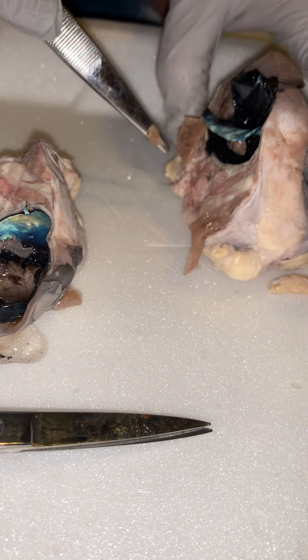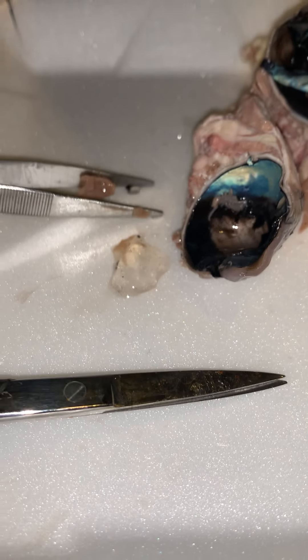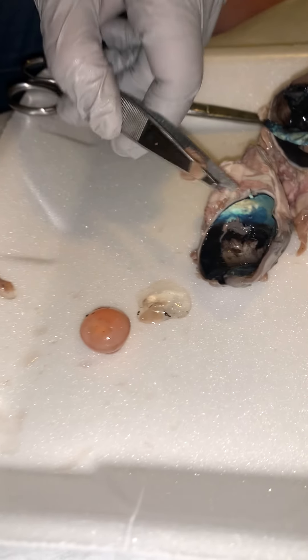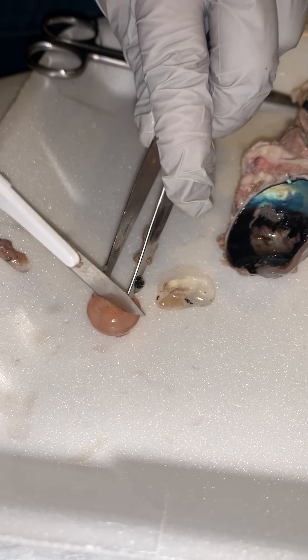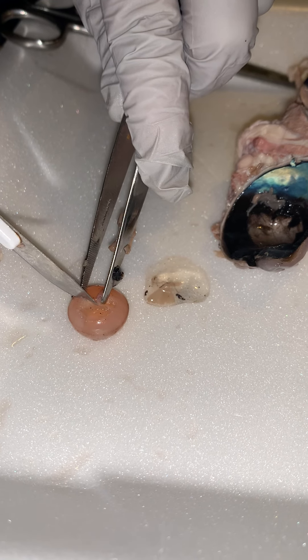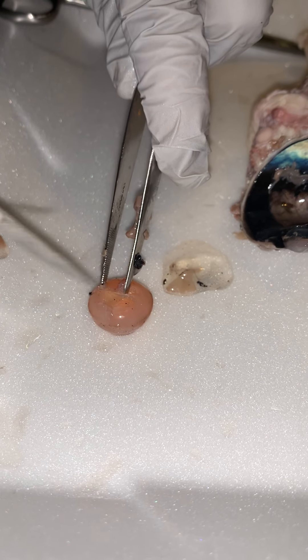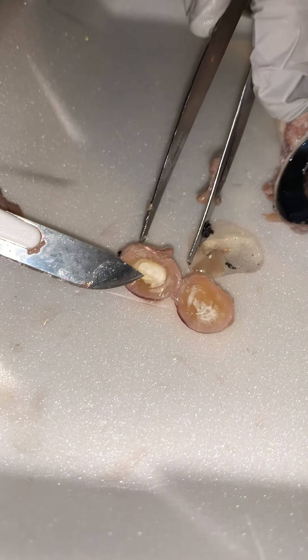We're going to go back to our lens. If we cut this open — I'm going to be real careful because it's real round and bouncy — if we're able to get this open here, it actually has kind of onion-like structures in the lens. There we go. If you zoom in there, you can actually see those onion-like structures in that lens.